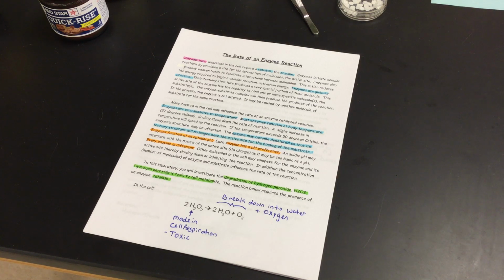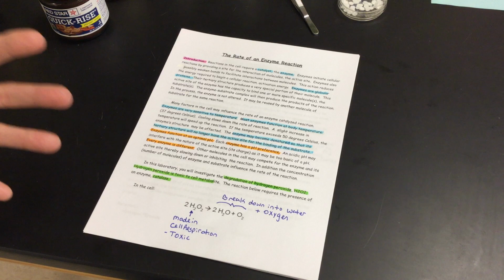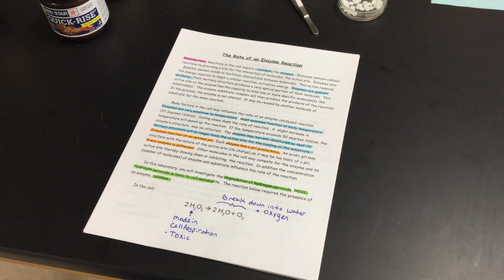So today what we're looking at, within this enzyme substrate complex, are the effects of temperature as well as pH and the roles that they play on the reaction rate of the reaction that we're about to see. We know that temperature will affect enzymes, and we know that body temperature is probably the best temperature for these enzymes to act in. So usually around 37 degrees Celsius, 98.6 degrees Fahrenheit, these reactions should run very, very quickly.